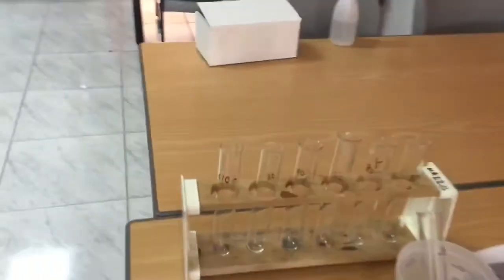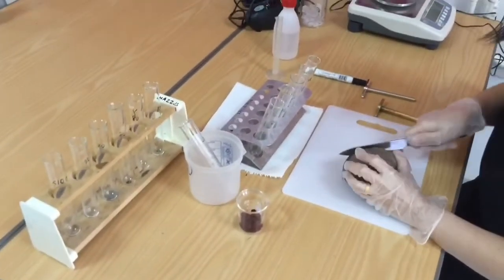This is required practical 4, which is an investigation into the effect of temperature on the permeability of cell surface membranes of beetroot.